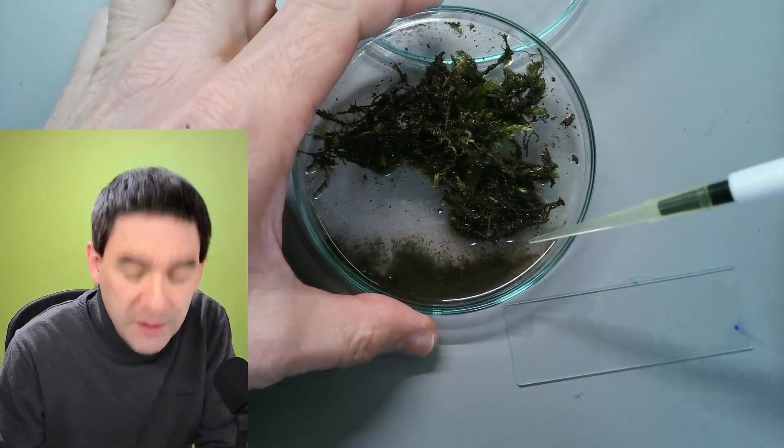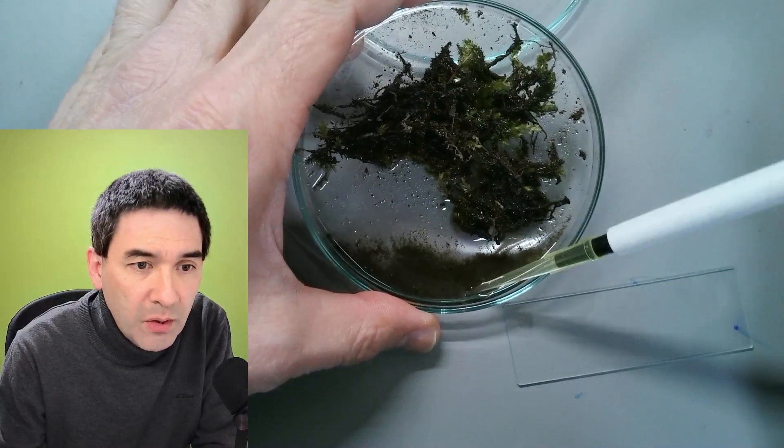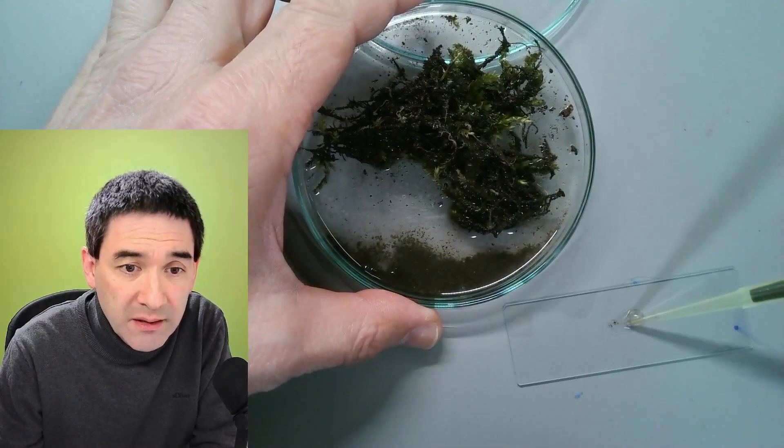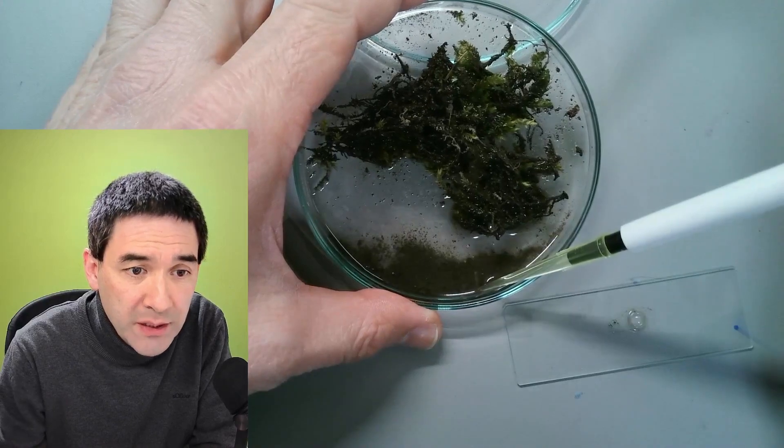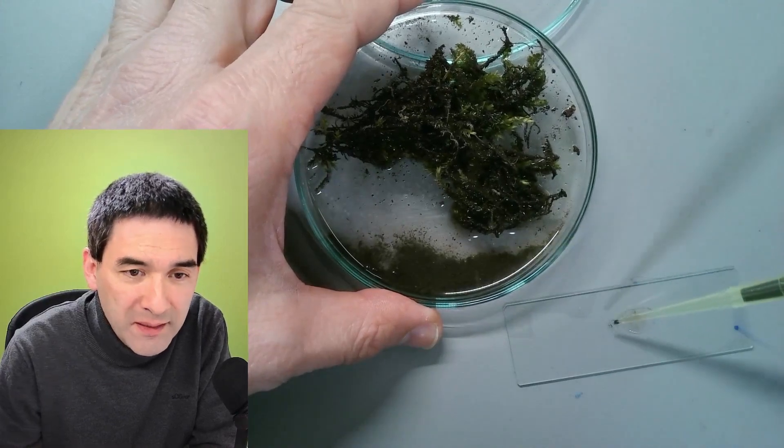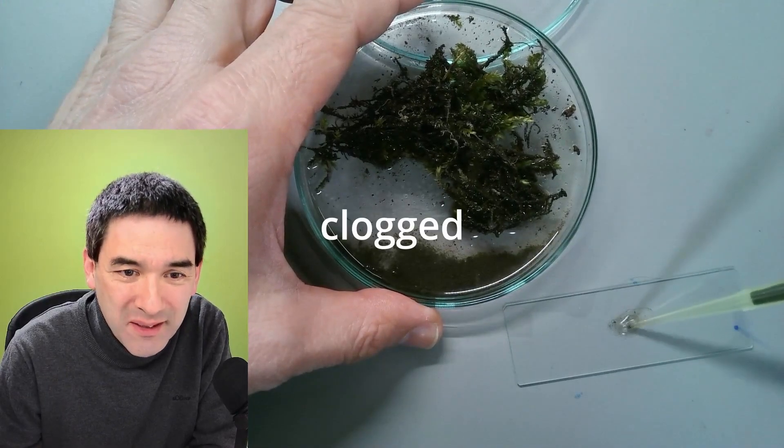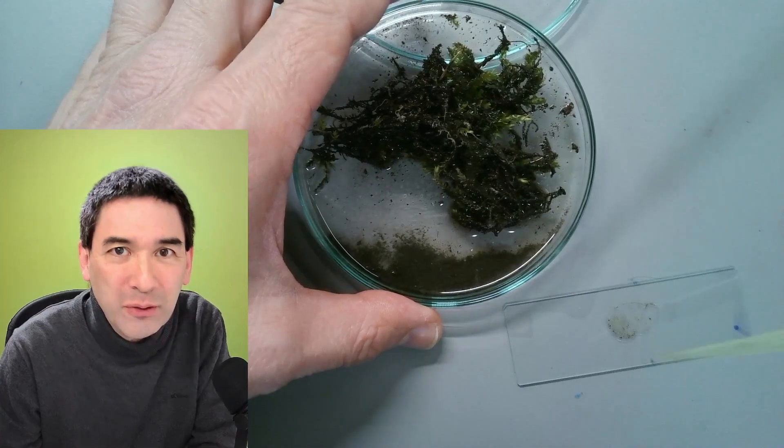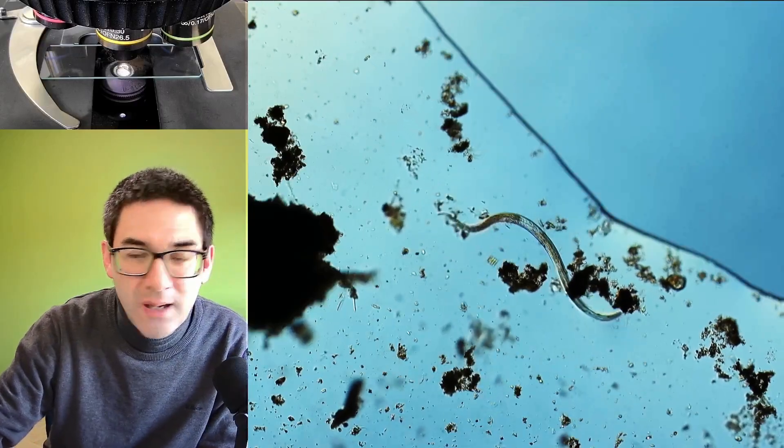So here we go. What you want to do is take some of this solid material here and simply put it on a slide and then spread it apart a little bit hoping that the pipette doesn't become stuck. And I think we're just gonna have a look now.